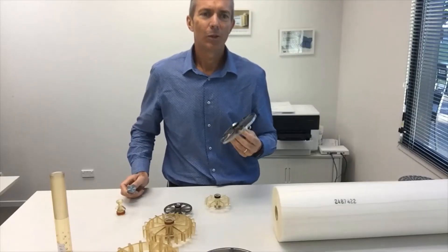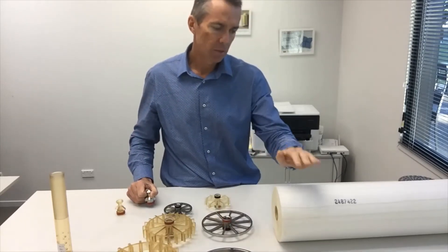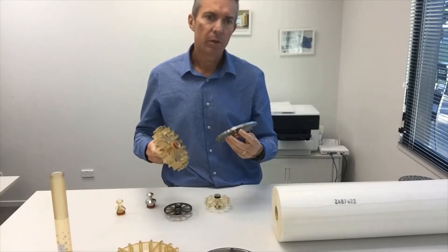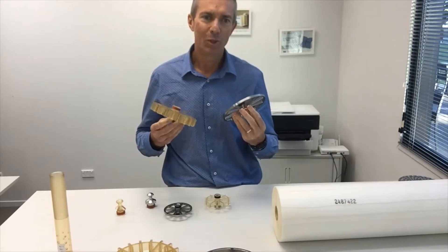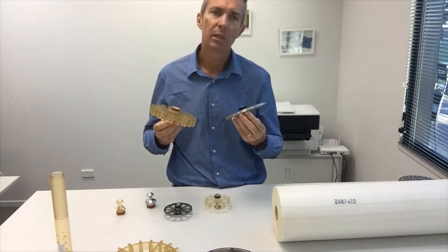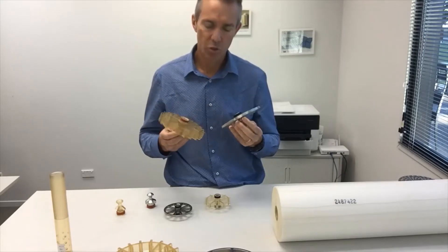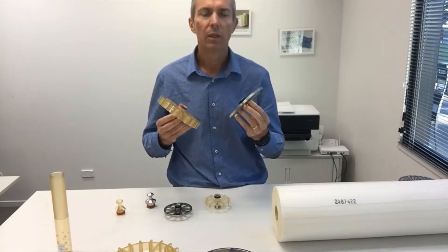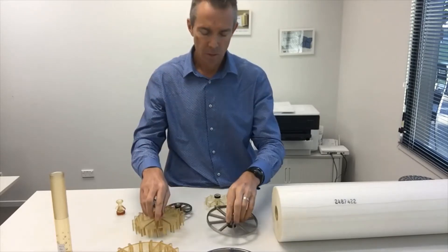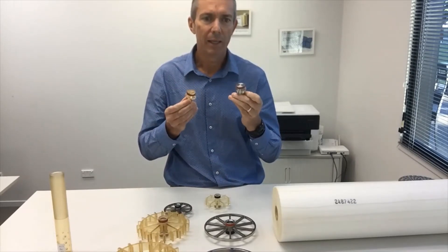Hi everyone. Today I would like to talk about anti-telescopic devices and blank end plugs for use in sanitary spiral wound membrane filters. The anti-telescopic device is more commonly referred to as an ATD, but also goes by the name of seal carrier, interconnector, membrane end cap, and sometimes membrane coupler. All these descriptions refer to the same product — today we will simply refer to this as an ATD. Blank end plugs we will simply refer to as blank end plugs.